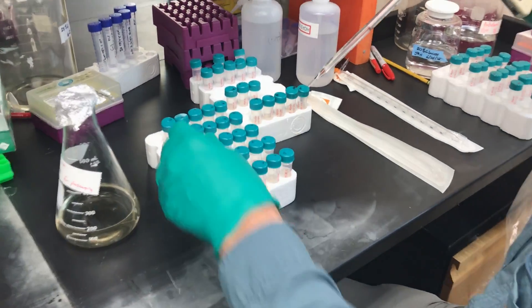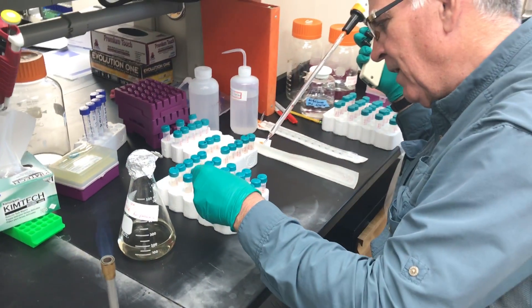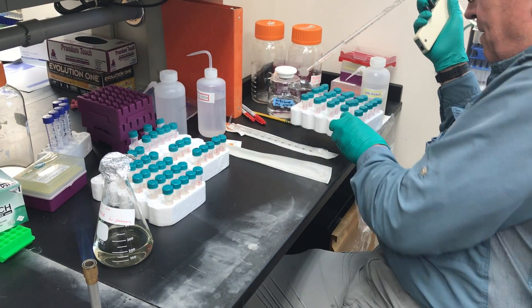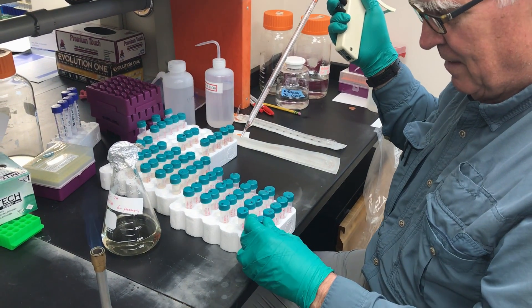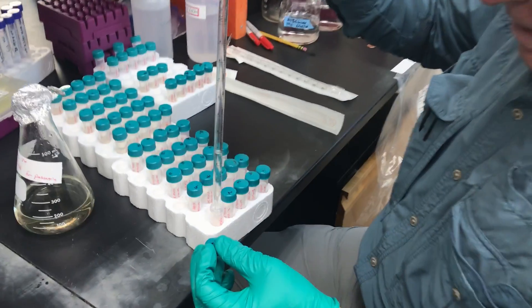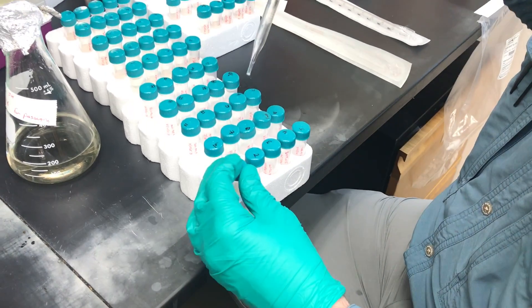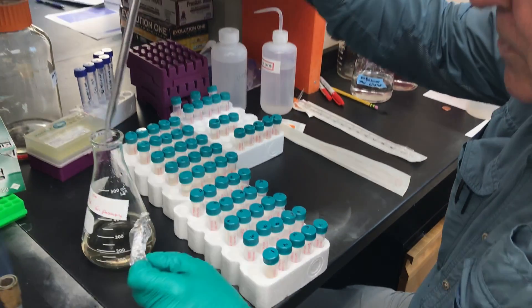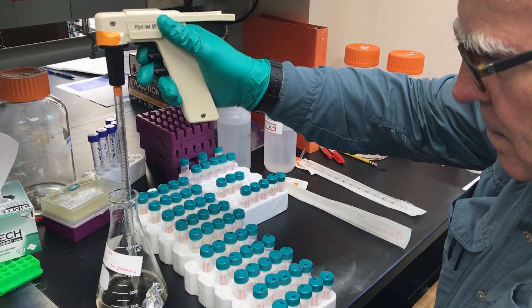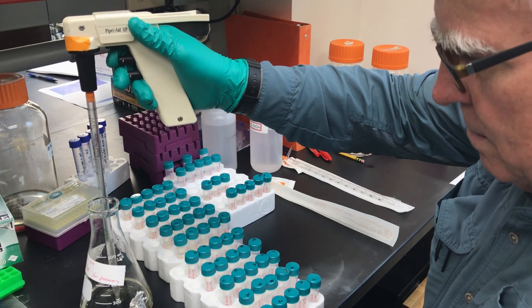That's good, but these are the 20 degrees and I need the 30 degrees. My bad — this happens. We'll make sure that this is right, we're ready to go. Here's the 20 degrees. This is why you always have to check and double check, or else you overflow your tubes.